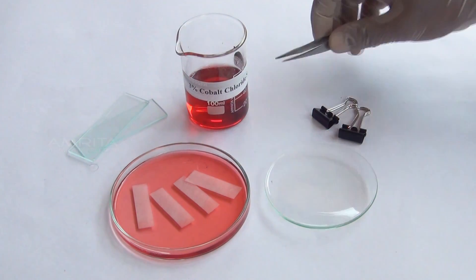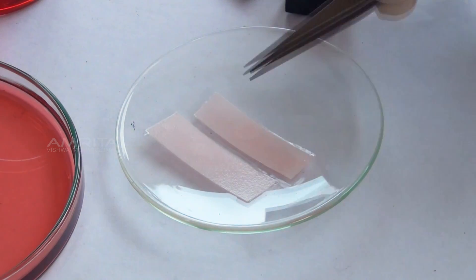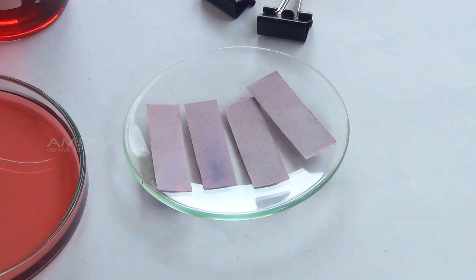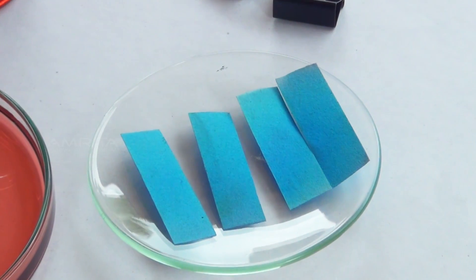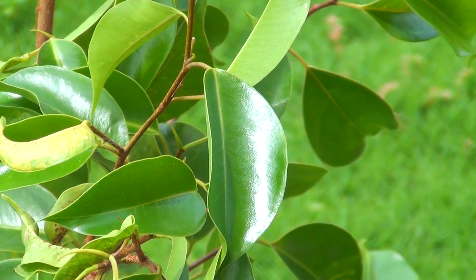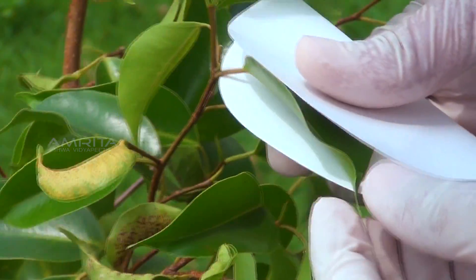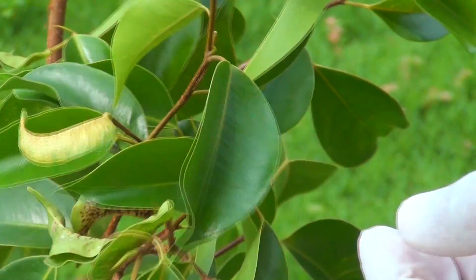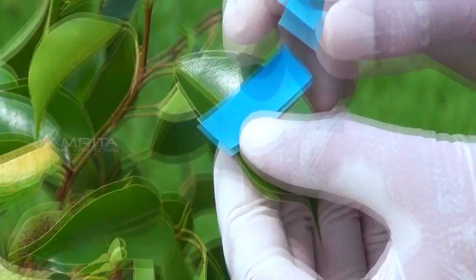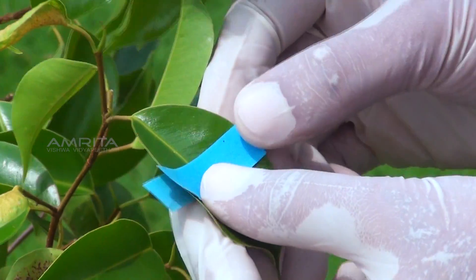Remove the strips from the solution using forceps. Place the strips into the watch glass to allow the filter paper strip to dry. The filter paper becomes blue in colour on drying. Select one healthy leaf and clean the leaf to remove water droplets using a filter paper. Place the dried discs of cobalt chloride paper, one on the upper and the other on the lower surface of a leaf of the potted plant.